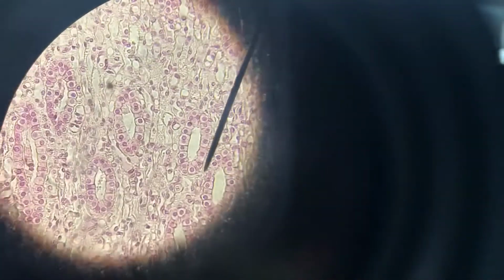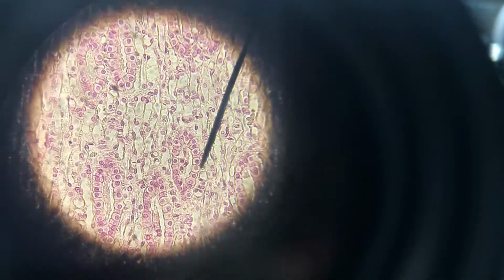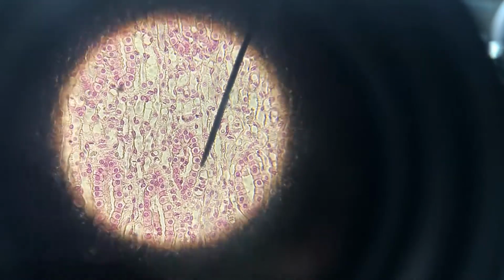The thing about most tissues is that you transition from one cell type to the next. So on the practical, it would be very obvious. These are very obviously cuboidal cells here, all around here. They're as tall as they are wide. Basal surface right there at the pointer, simple cuboidal tissue all around.